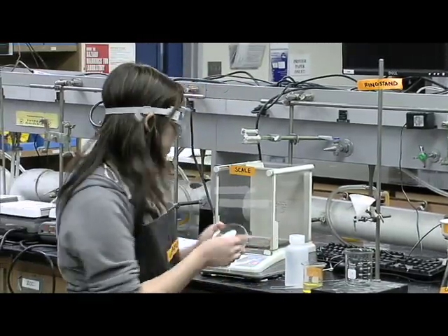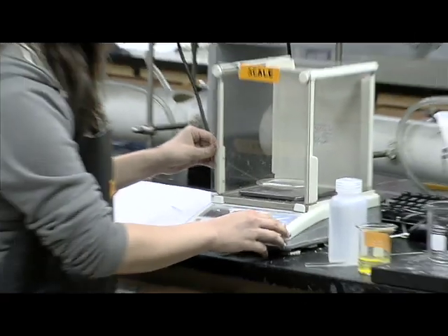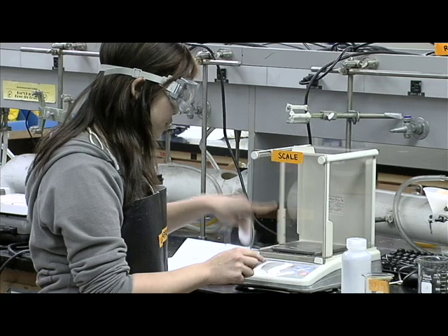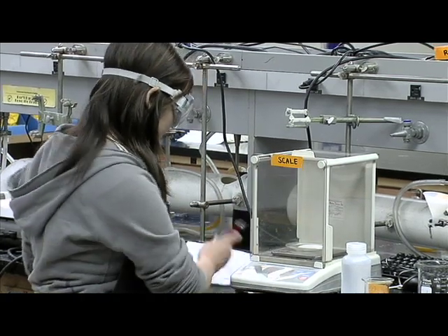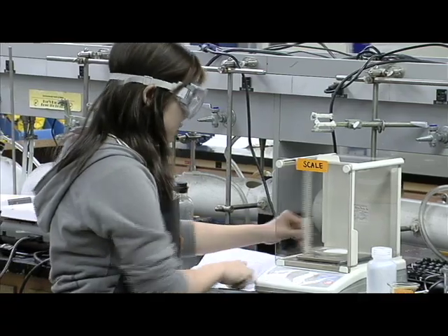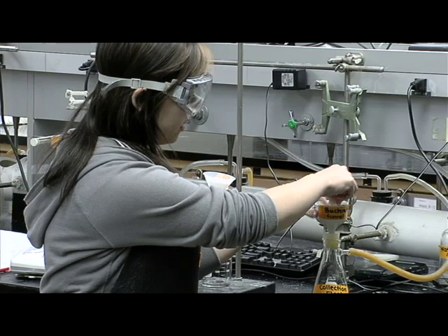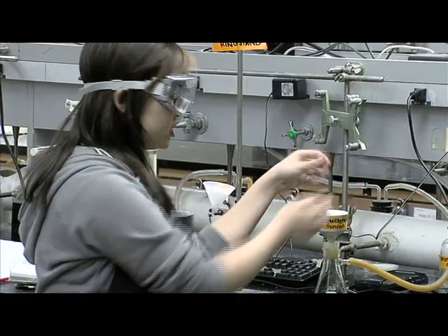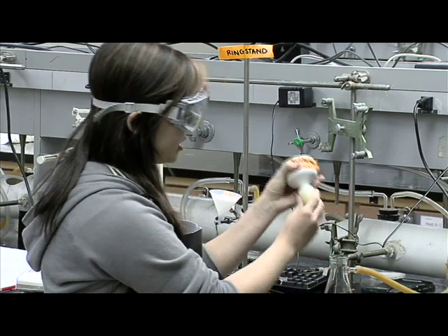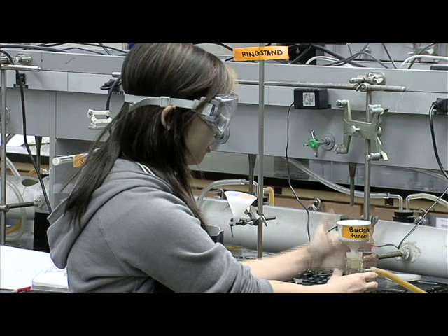First, you weigh the watch glass and the filter paper, just like in the gravity filtration. Zero the scale out first so there's nothing on it, and then you weigh it. Once you have that mass, you can set it aside. Take the filter paper and place it into the Büchner funnel — it should fit nicely. You can scrunch it or cut it to make the filter paper fit.